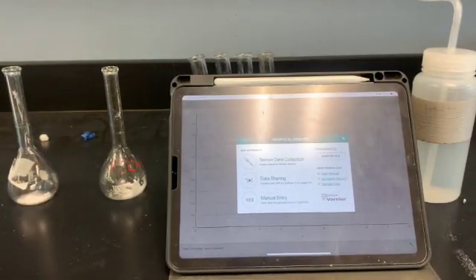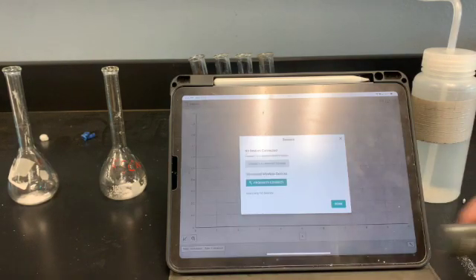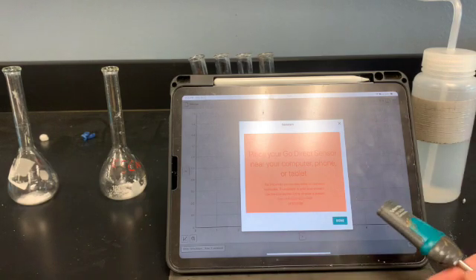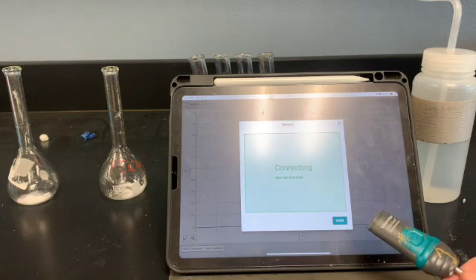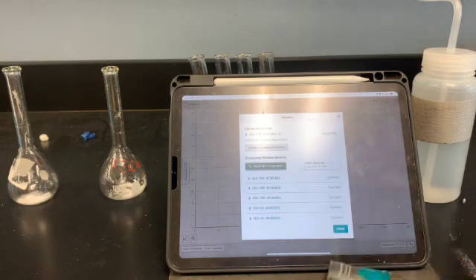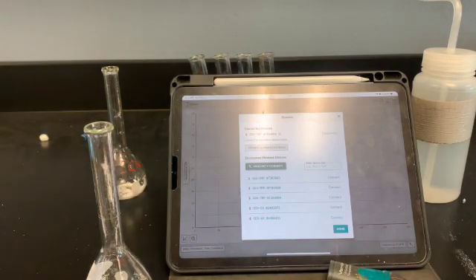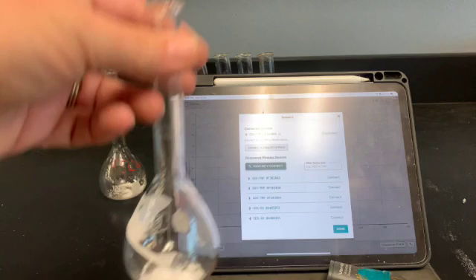Okay, we're going to do the solubility test, and we've gotten a small amount of our substance. We're going to connect a temperature probe up. We want to see if there's any exchange of energy as we're doing this. The instructions do say small amounts of water. I would recommend that you get your volumetric flask. We want to make 100 milliliters of it, and we're simply going to be filling and looking, filling and looking. So you're going to take your time on this.